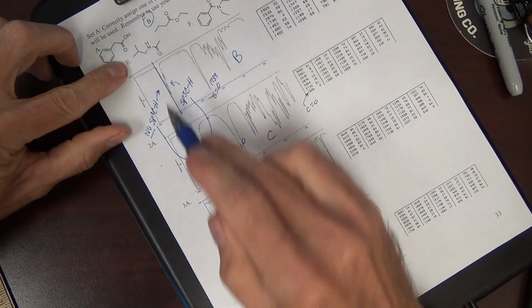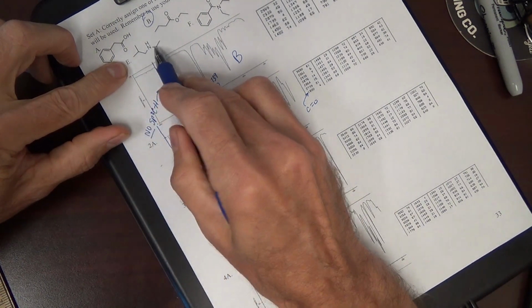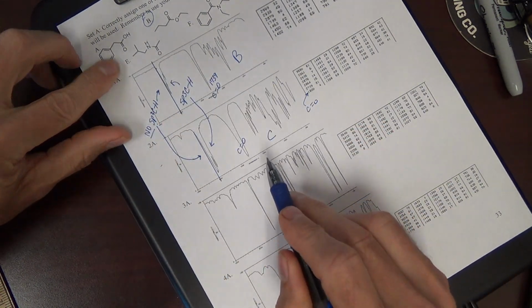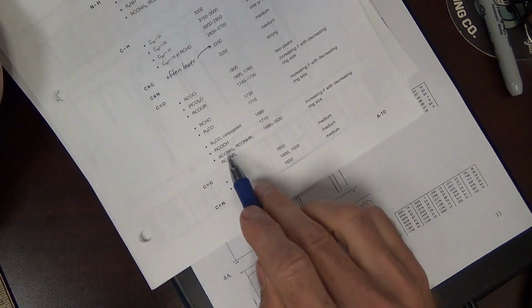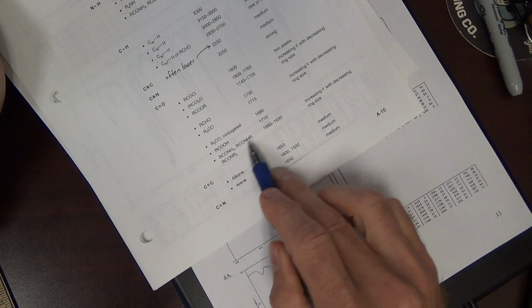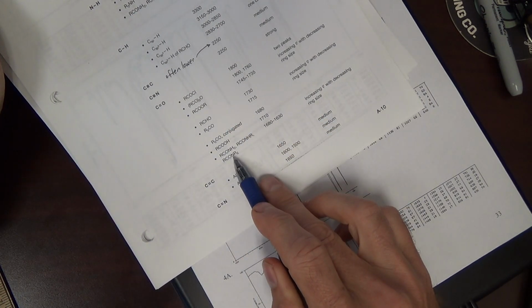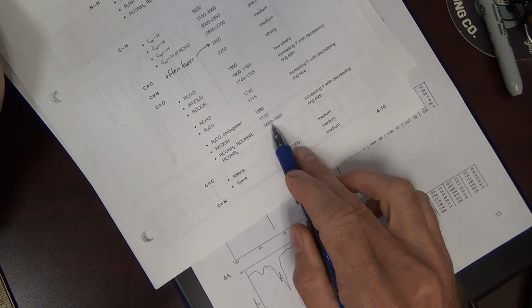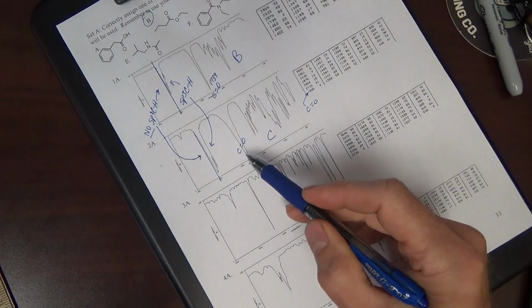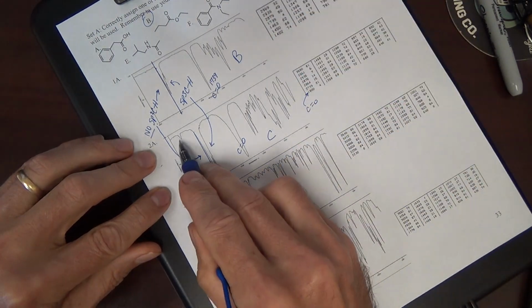But it's not E. The answer is not E, mainly because that's an amide, and an amide carbonyl is going to be, okay, these are your amides condensed down. Make sure you understand these condensed drawings. Amide carbonyl is mid-1600s. That is not an amide carbonyl. The answer is C. What is this?